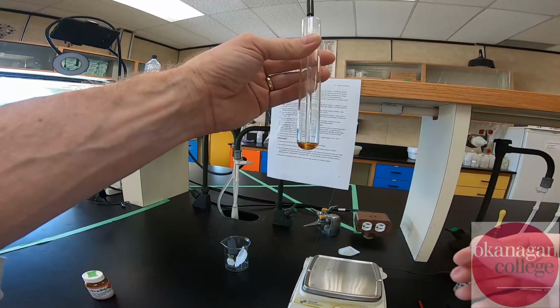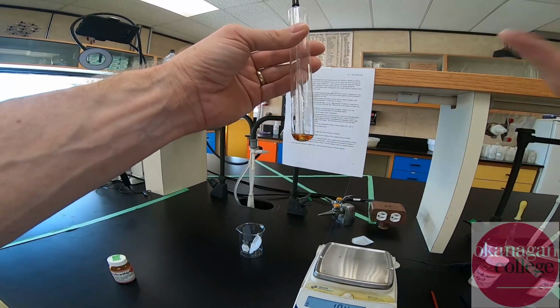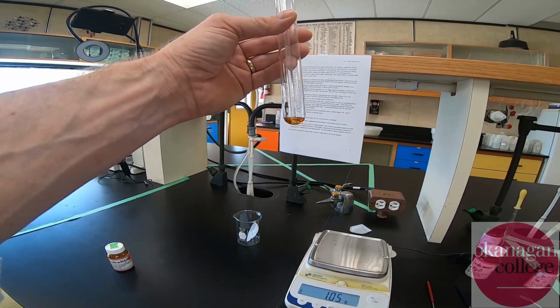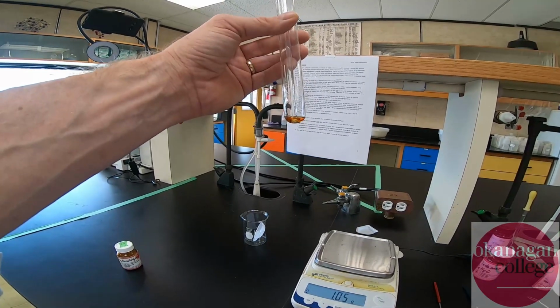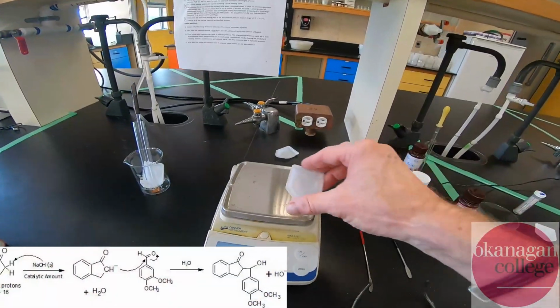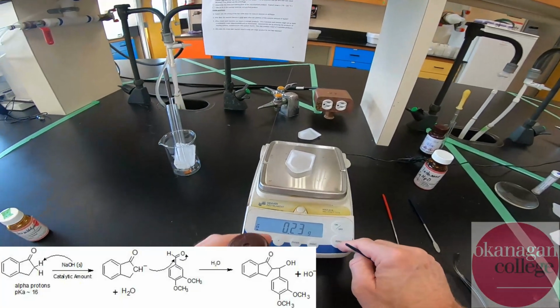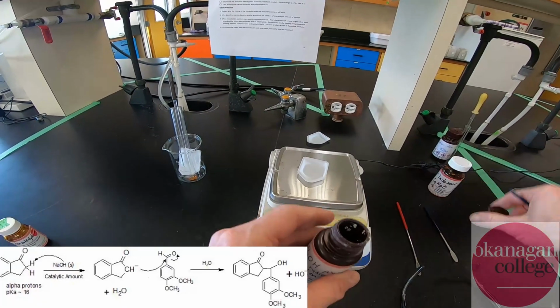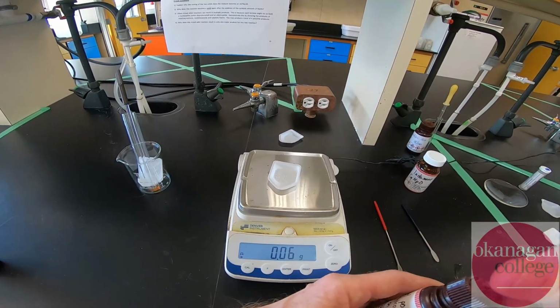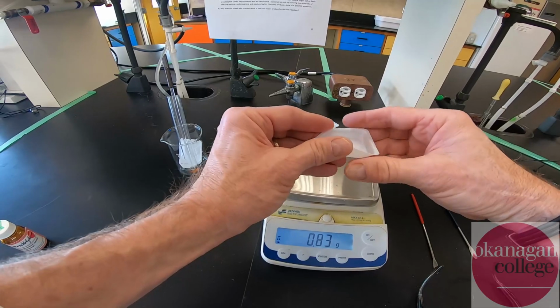Okay, so now we're going to weigh out some sodium hydroxide. That's the catalytic amount, introduced to get the reaction going. The sodium hydroxide will cause a deprotonation of the indanone, and then the indanone acts as a nucleophile to react with the benzaldehyde. Again, it's a catalytic amount, so as best we can, I'm going to try to put in 0.05 grams of sodium hydroxide. We have a touch more, 0.06, but again, it's intended as a catalytic amount. Take a look at the mechanism and you'll understand why it is a catalytic amount.